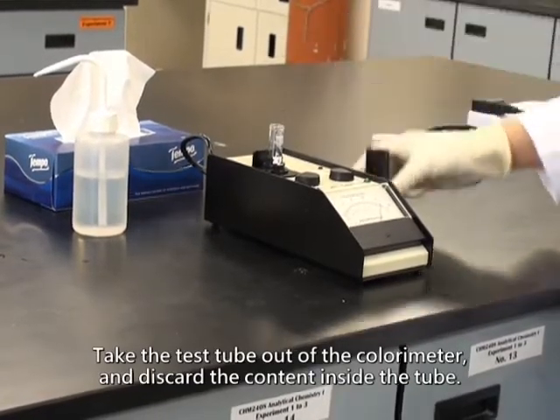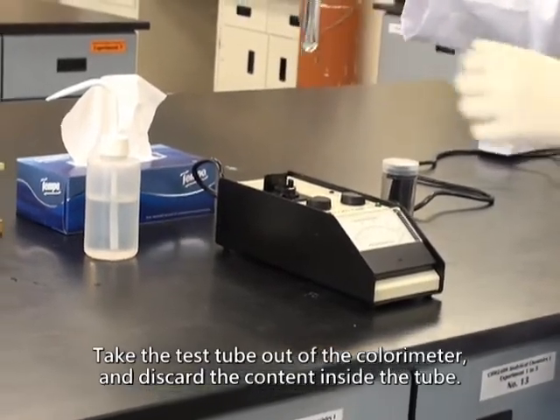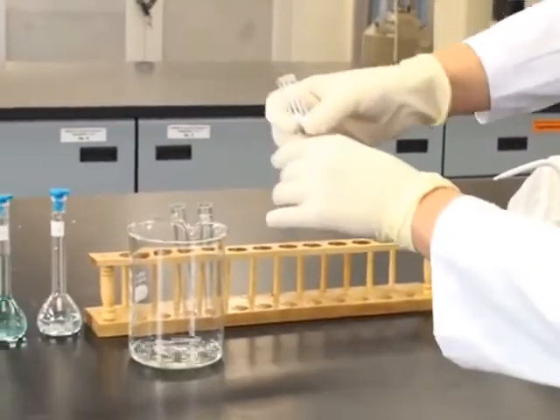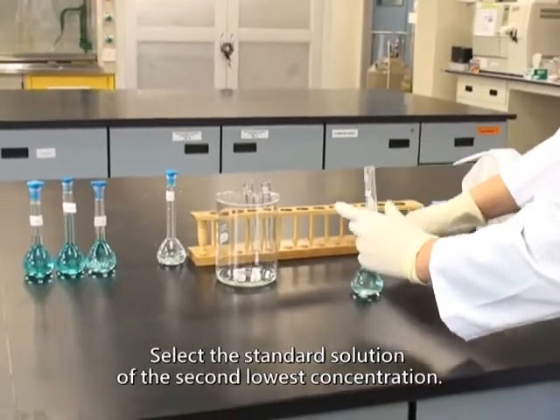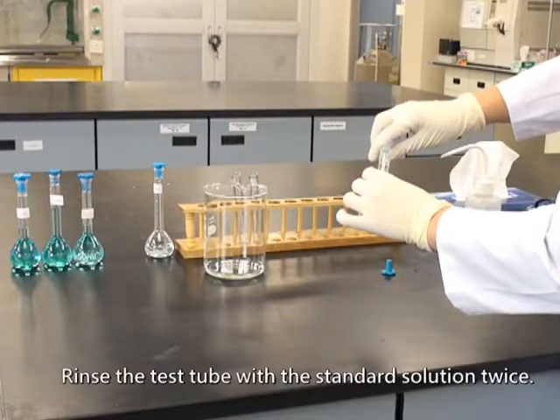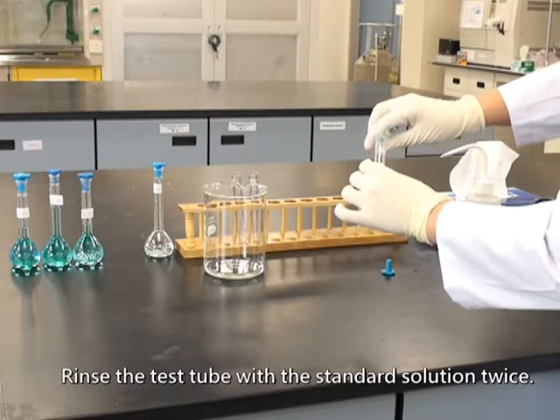Take the test tube out of the colorimeter and discard the content inside the tube. Select the standard solution of the second lowest concentration. Rinse the test tube with the standard solution twice.